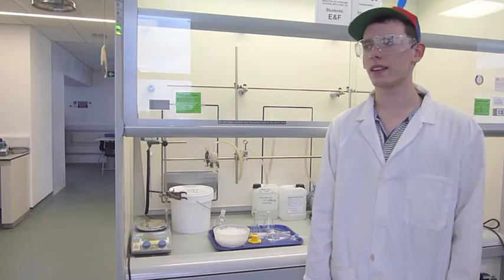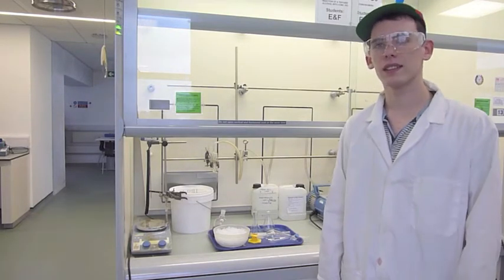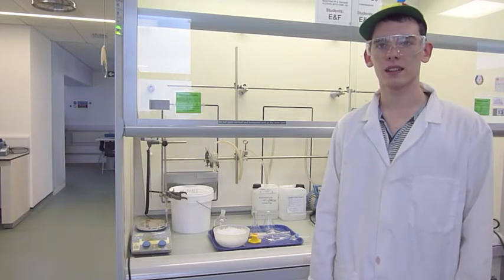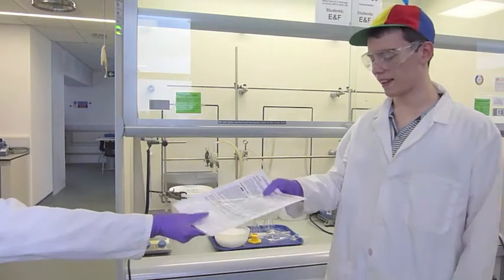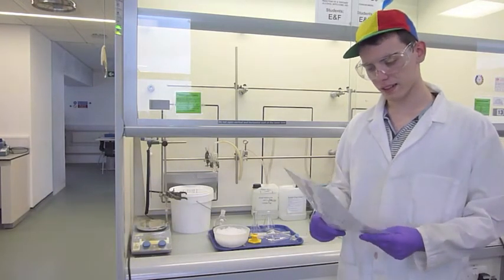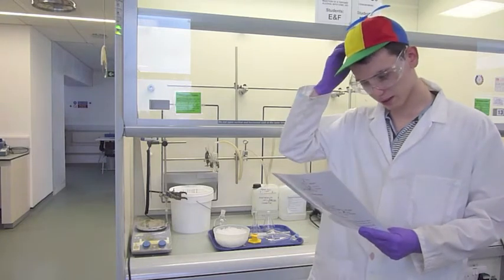Okay, Johnny. Now you've got your equipment, it's time to read your method for the day's experiment. This is the protocol. It contains a list of the things you've got to do. Give it a quick read, and then we're good to go.